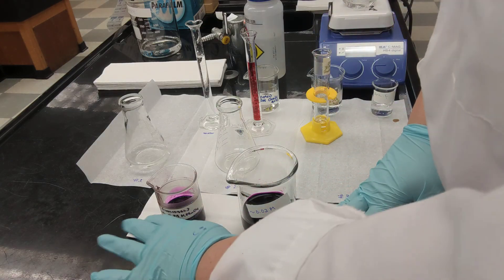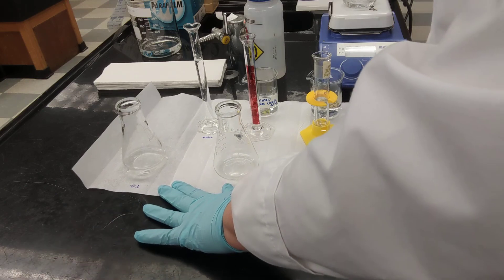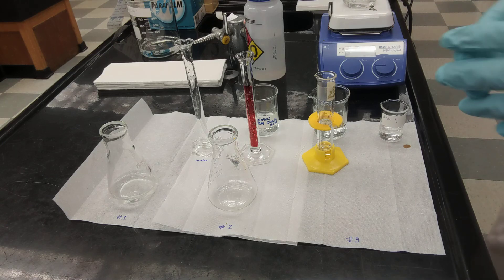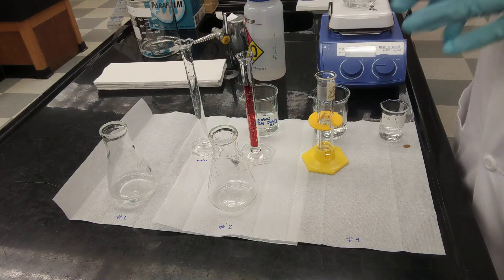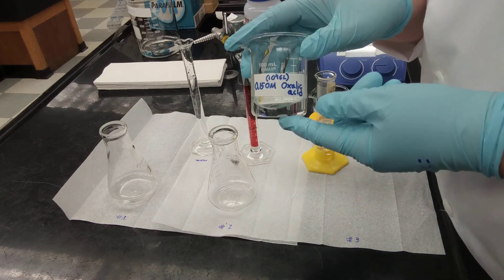The first thing we're supposed to do in this experiment is preparing the dilution of potassium permanganate. I have the diluted solution ready, and this is the one I need to use in my burette as the titrant. Now, for the sample preparation, we're using oxalic acid with a known concentration equal to 0.15 molar.